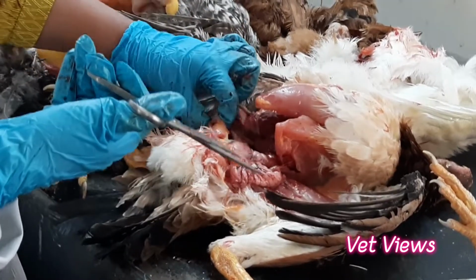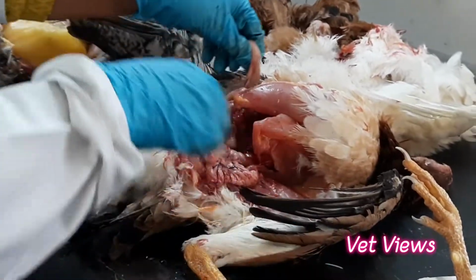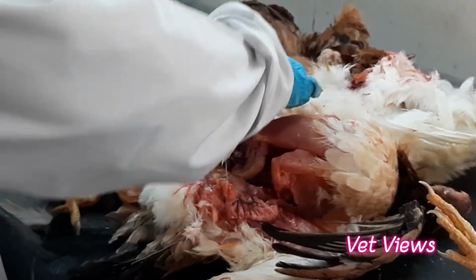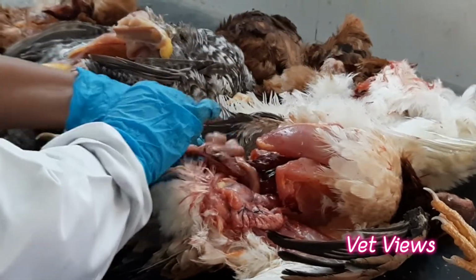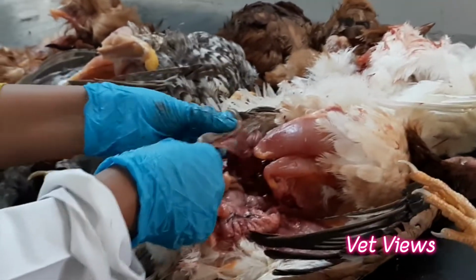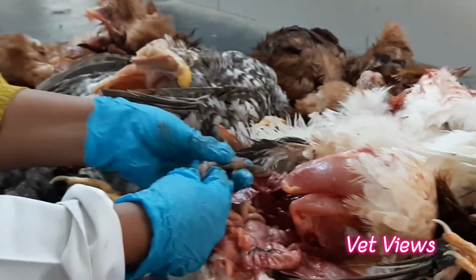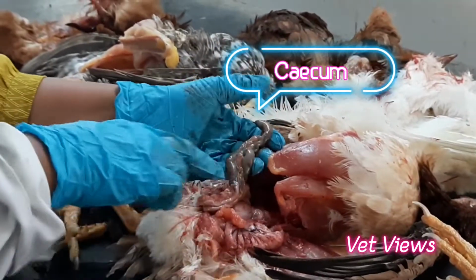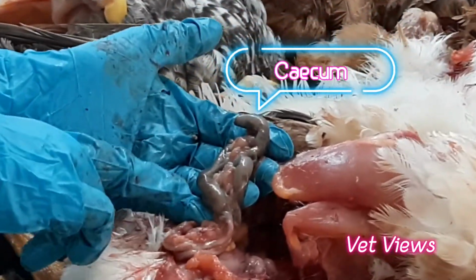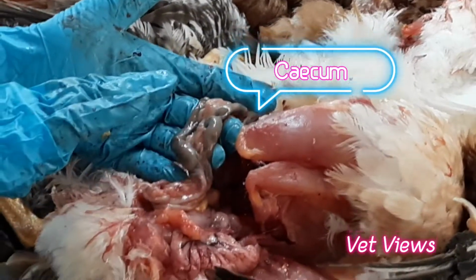Subsequently you have to come down to the cecum. The cecum is the main indicator for coccidiosis. These two are the cecal loops. These two blind pouches are there. Generally fermentation happens here, so that's why the contents look very dark. This is the normal color of the cecal loops.